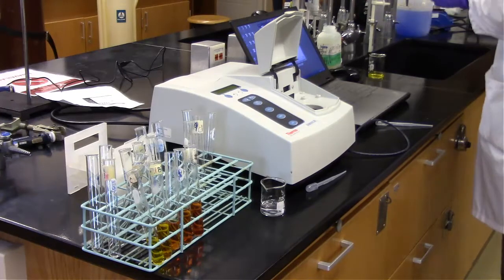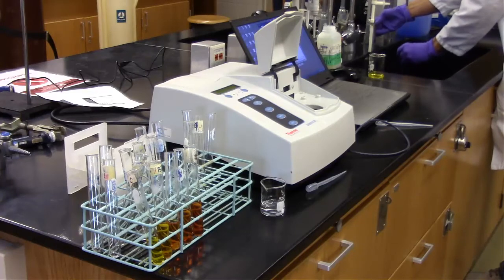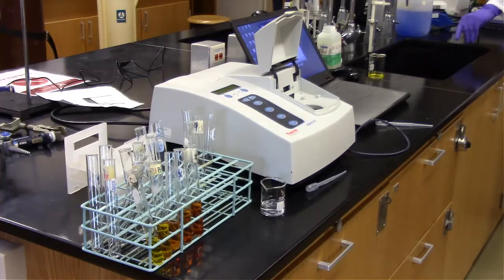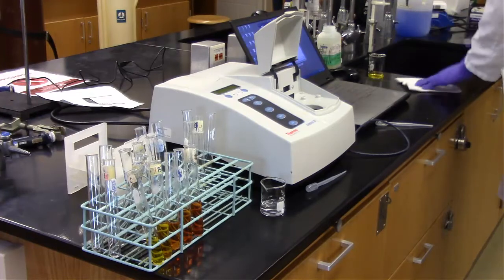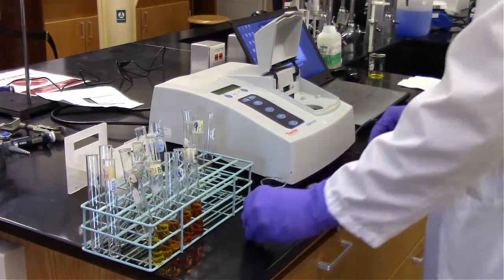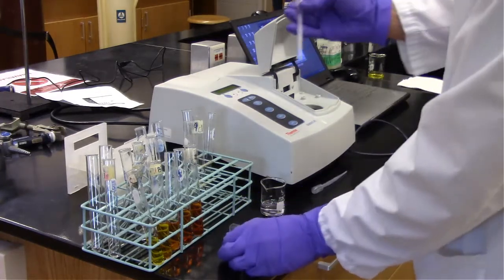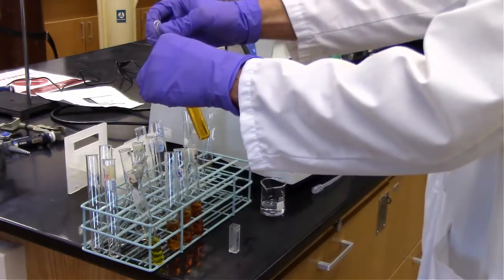See there, I'm dumping all those into that beaker, and then I'll rinse them in the sink to make sure that glass is thoroughly rinsed. I didn't dry it thoroughly each time. I actually didn't dry it thoroughly after I ran my water sample through there. So there's a small amount of residual water for each one. That's kind of why I didn't dry it after I ran that water sample, so that it wasn't biased, making that first one more concentrated.